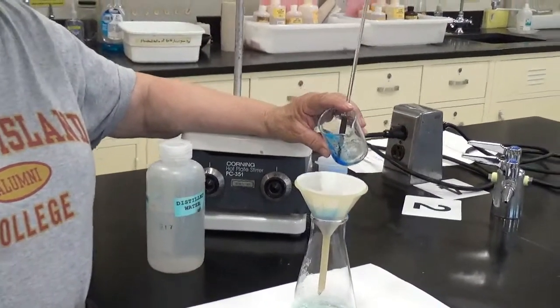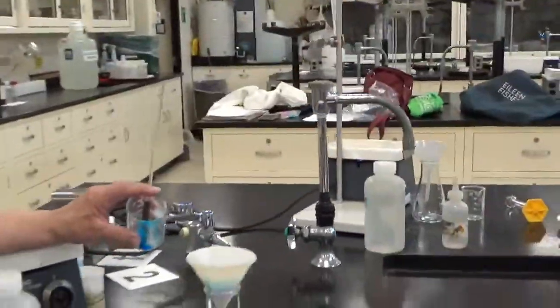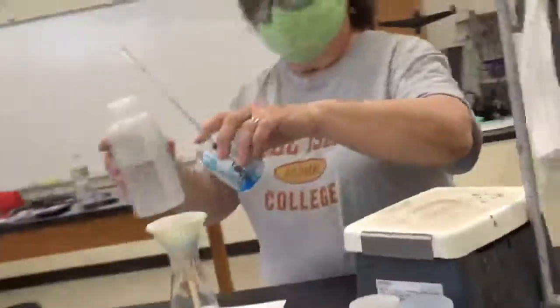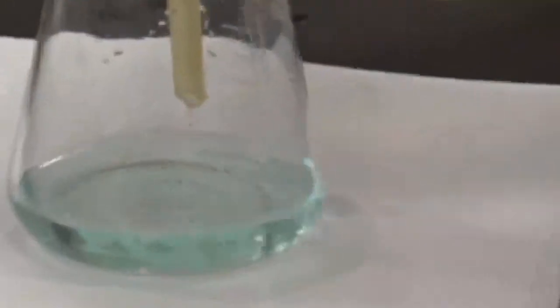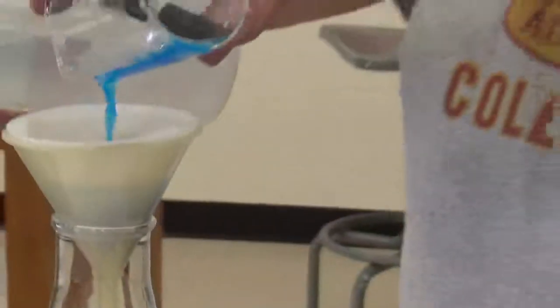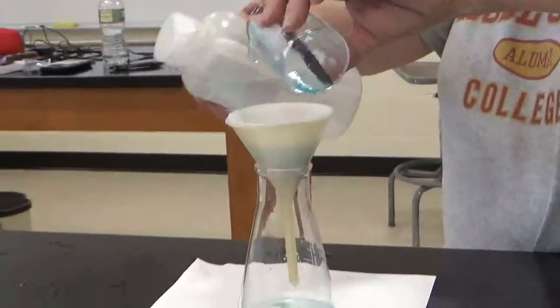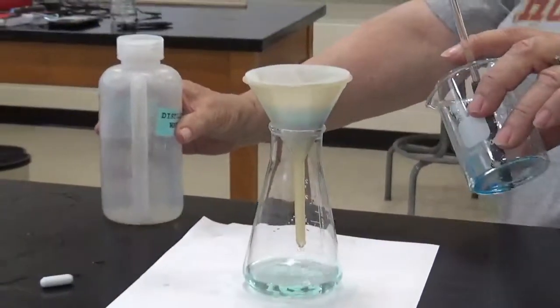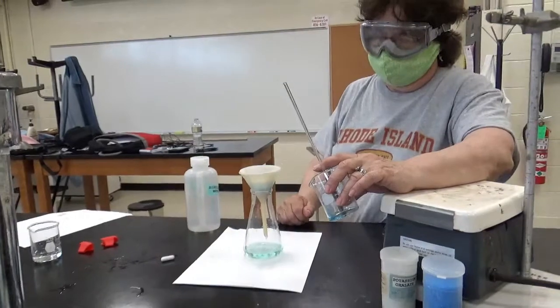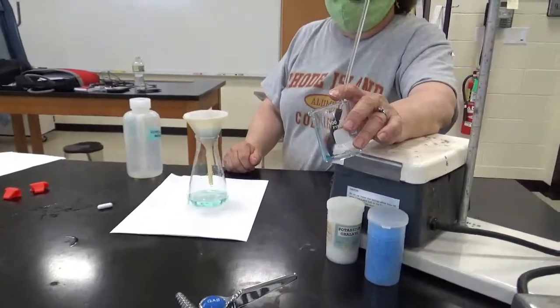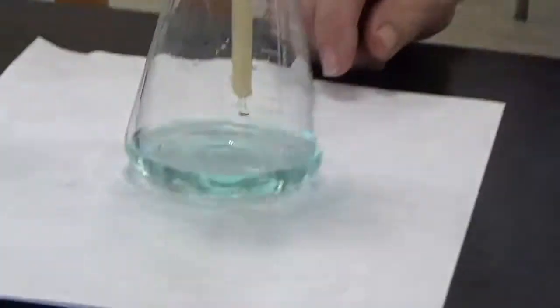But we don't use coffee filters, we use Keurigs now, so we don't see this. I'm going to use a little water, and the trick is to use the water and to tilt it. To tilt it at the same time as using the water. We don't want to fill it with water to the top. I'm going to show you the liquid that came through close up.